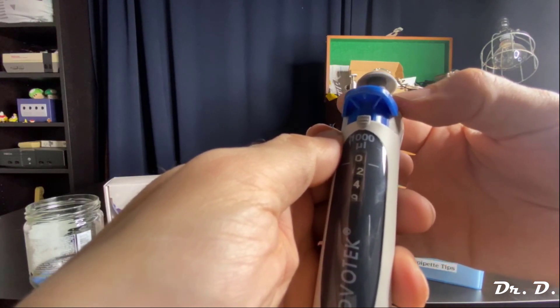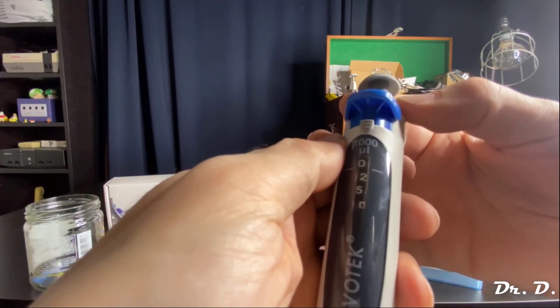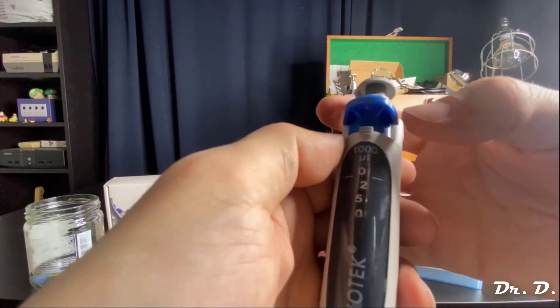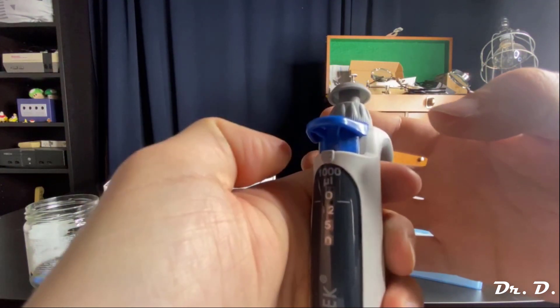Sometimes it's hard to get exact, but that's about 250. Then I lock it down.